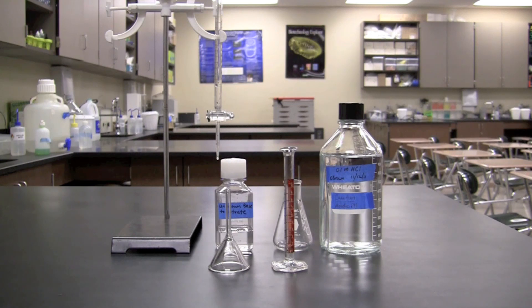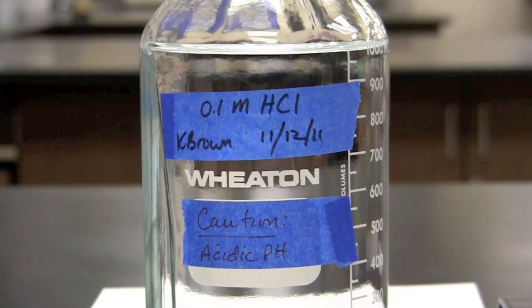In this video you will learn how to perform an acid-base titration. We will be using titration to determine the concentration of an unknown base using an acid of known concentration.